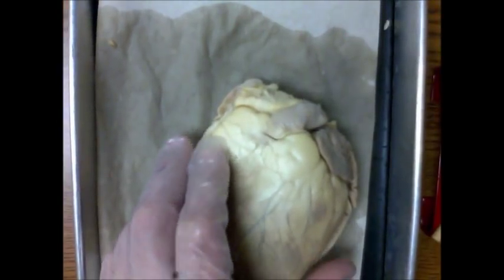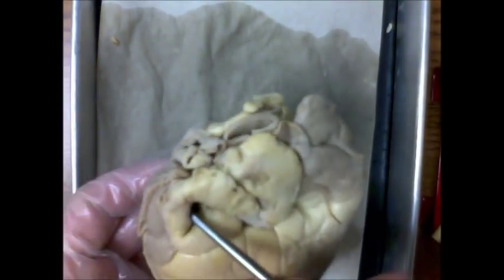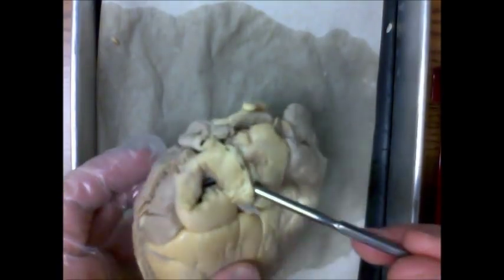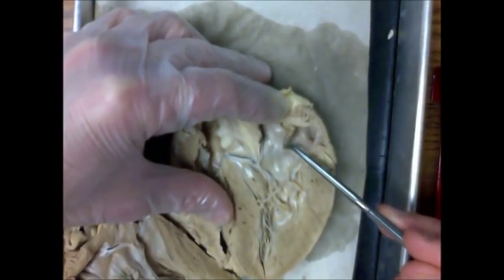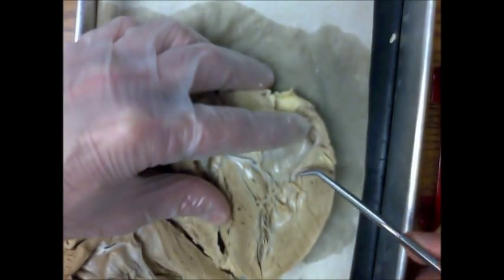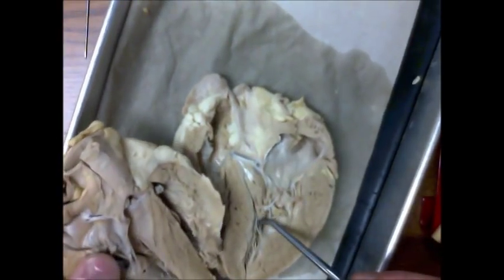Blood will travel to the lungs to get oxygenated and will return to the left atrium by means of the pulmonary veins. Pulmonary veins are often cut off on the back side of the heart. Here is the left atrium. Blood enters the left atrium and passes the second atrioventricular valve, which is the bicuspid. Notice the heart strings attached to the bicuspid. Blood then flows down into the left ventricle.